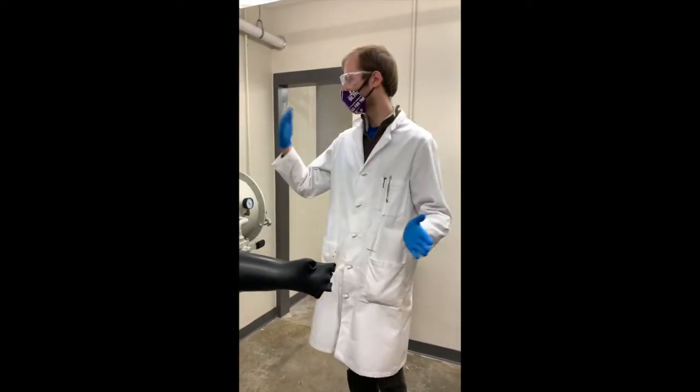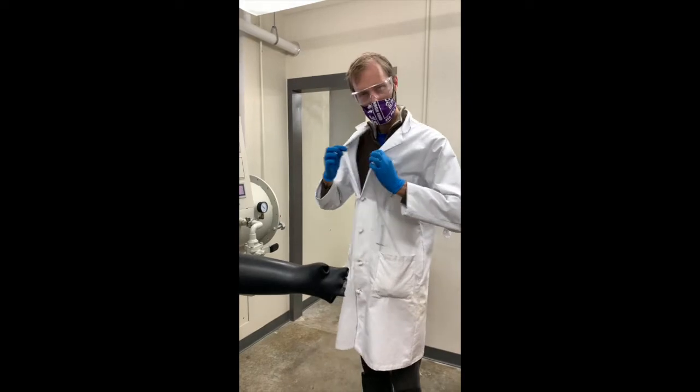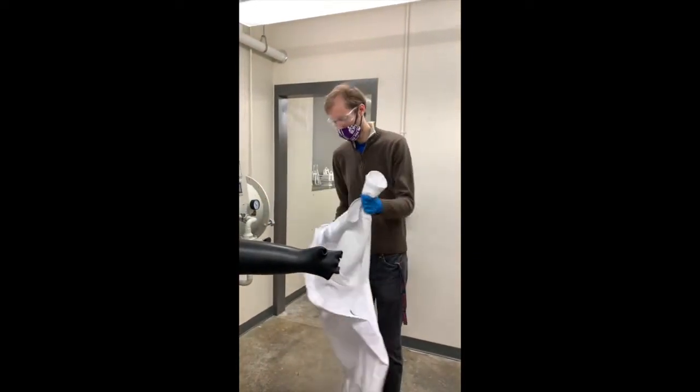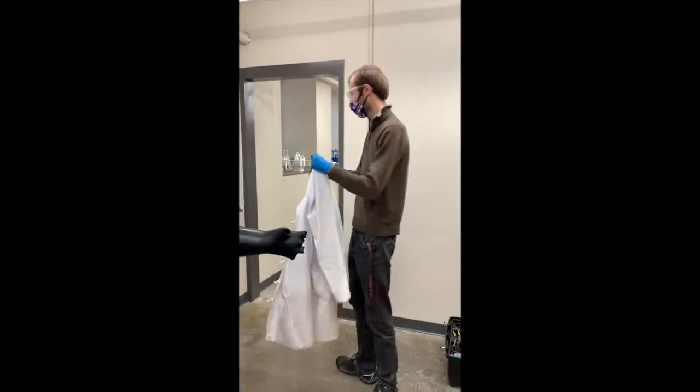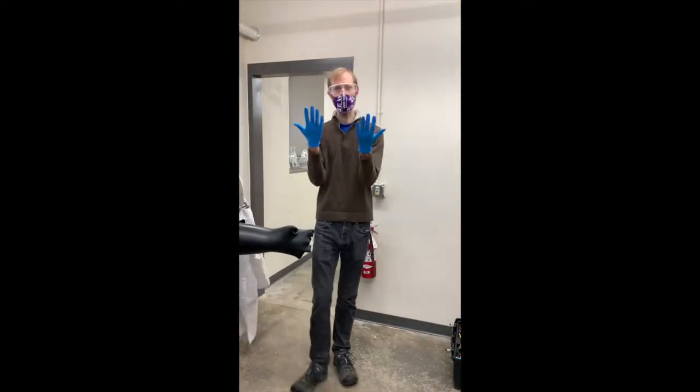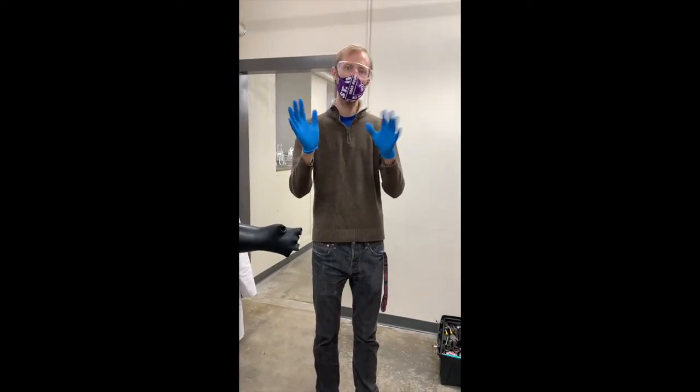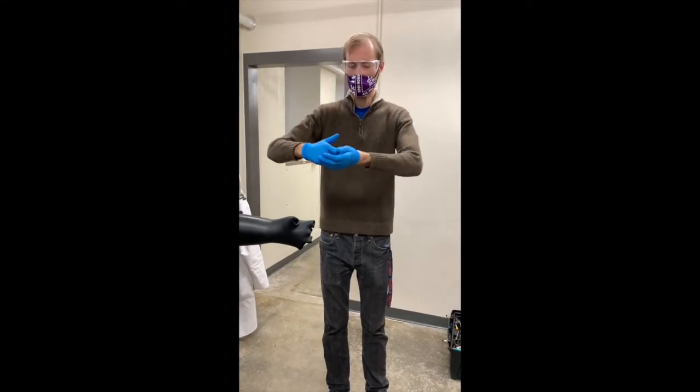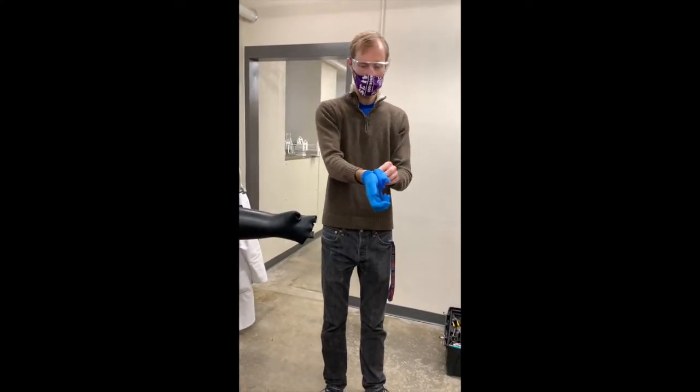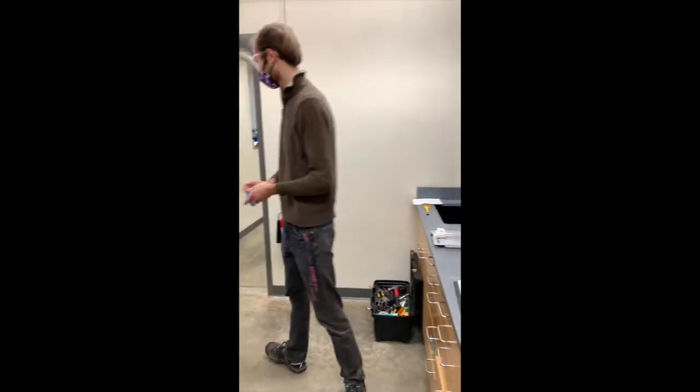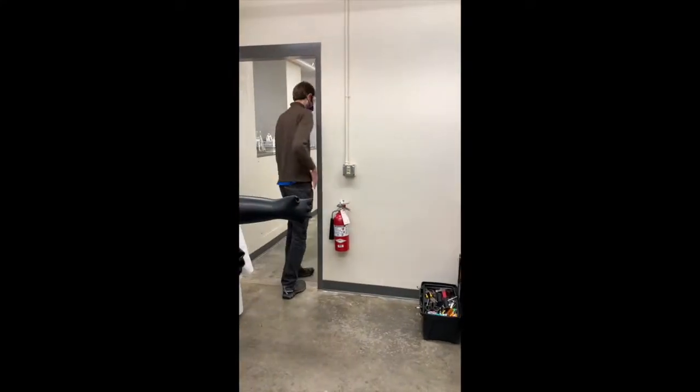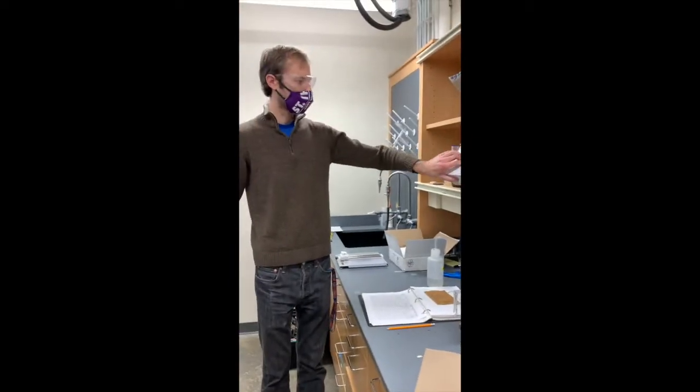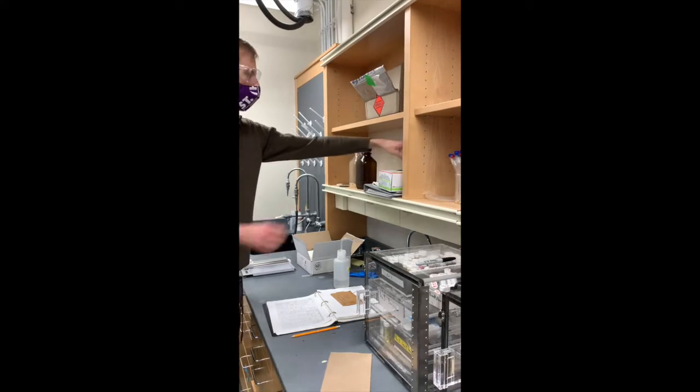So we've signed in, we've checked, and now we don't use the lab coat with the gloves. We'll pick them off. And you also want to get new gloves. These are contaminated. I was doing some stuff in the lab earlier so we do not want to contaminate the glove box gloves. I'll throw those away and usually we store a brand new box of gloves up here so I'll grab some of these.